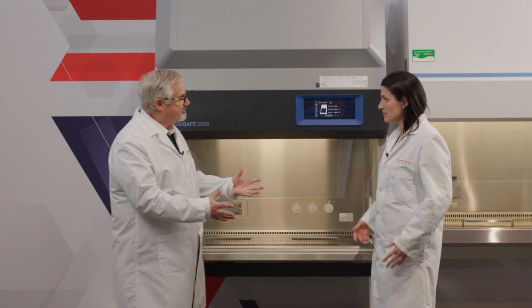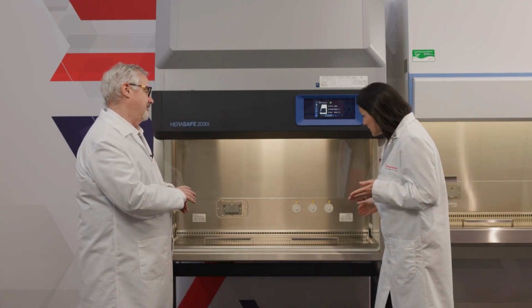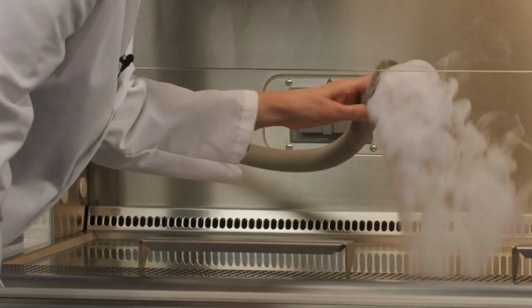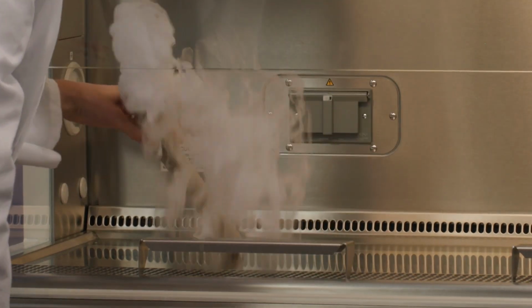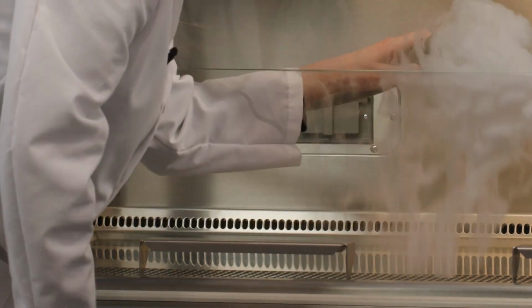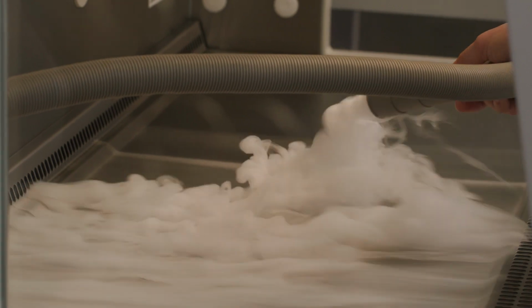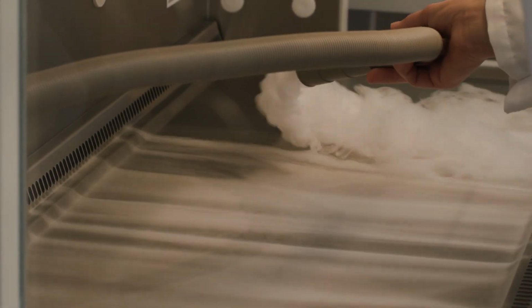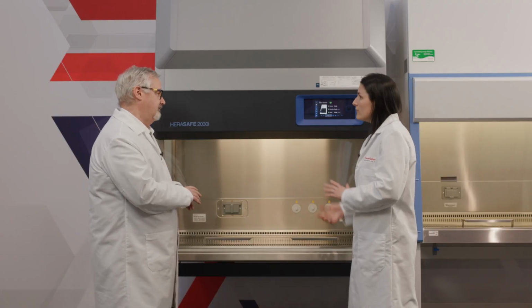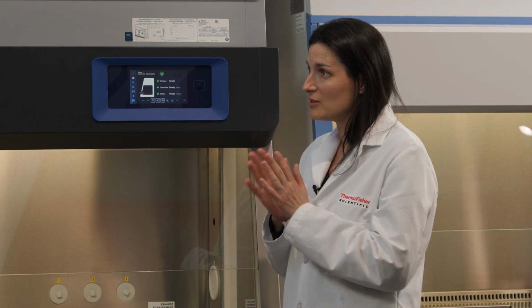Okay, so how'd you like the smoke? I really enjoyed seeing what the smoke could do. I really liked how it showed us how well there's containment at that front barrier, that you don't get smoke from the inside of the cabinet going out, or from the outside going in. Also, I really thought it was interesting showing that split that happened at the front grille and the back grille, where you got to see that that was localized. But of course, my favorite is the SmartPorts at the end. Getting to see that double negative pressure wall there is really cool.